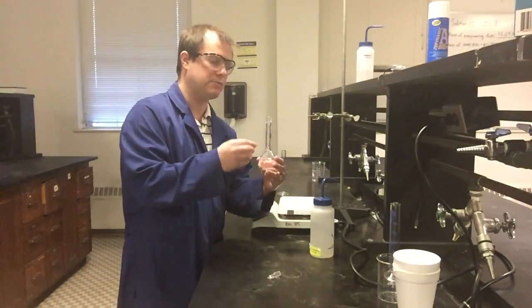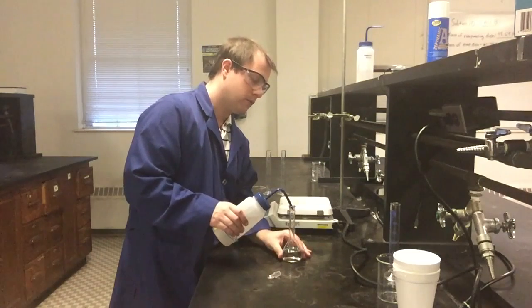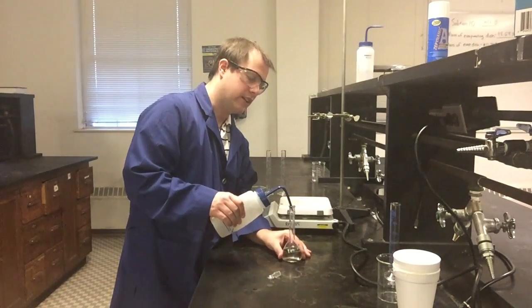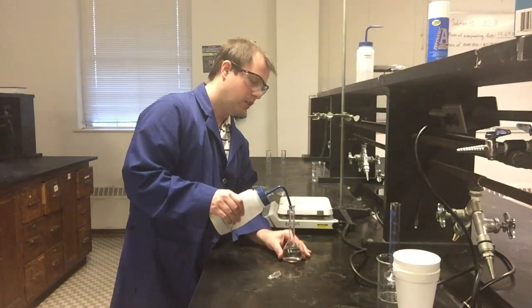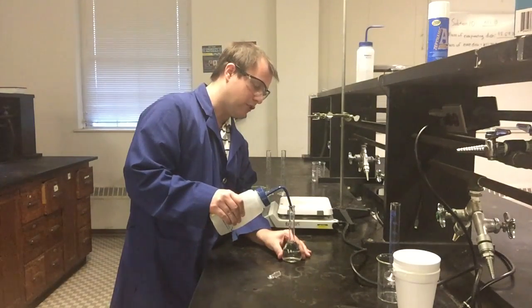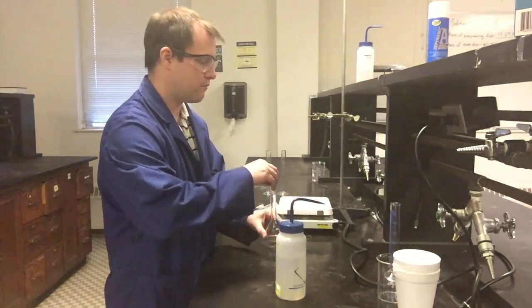I'm going to go ahead and at this point, now that I've mixed that up pretty well, add some more water up really close to my line, probably mix it once or twice more, and then I'll get it to that actual final volume. I have a squirt bottle that doesn't squirt very fast, because I was hoping to control it well at the end to get pretty spot on for our final volume, so hopefully that will work out well. So I'm going to mix this up a couple times here.